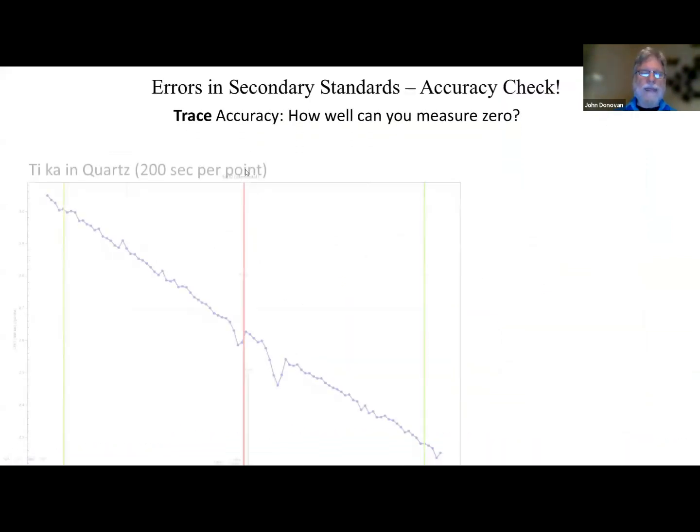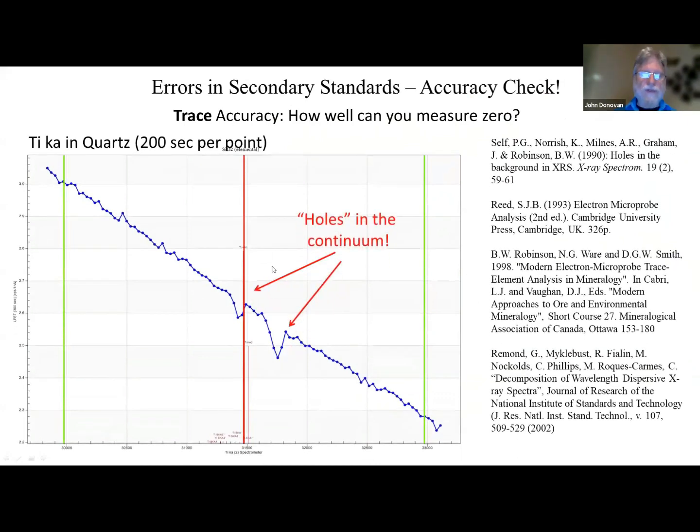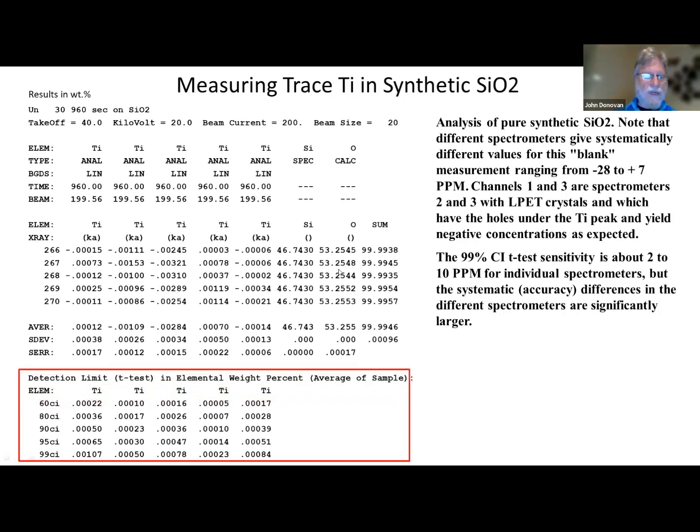All right, and again, trace accuracy, you can measure zero here, those holes in the continuum that some people have on their PET crystals, and that can be corrected for with the blank correction. Here's the blank correction. I'm just going to zip through this because I think I'm running out of time. But when we did this, we actually got, and this is measuring titanium on all 5 spectrometers. And then, of course, so we have good precision, but they all disagree with each other a little bit in terms of the absolute value, the average here.